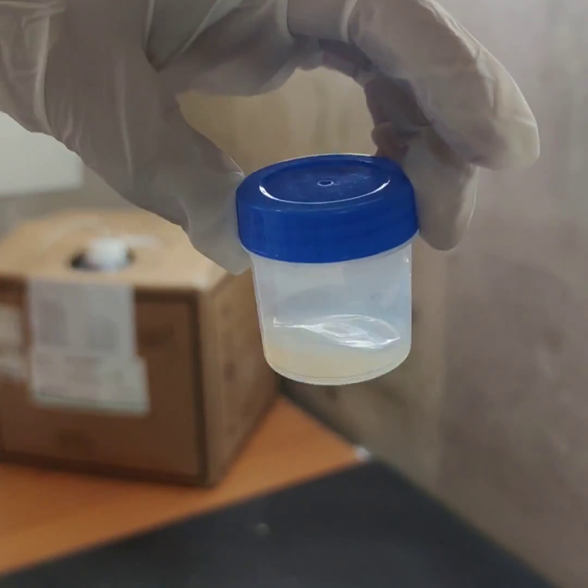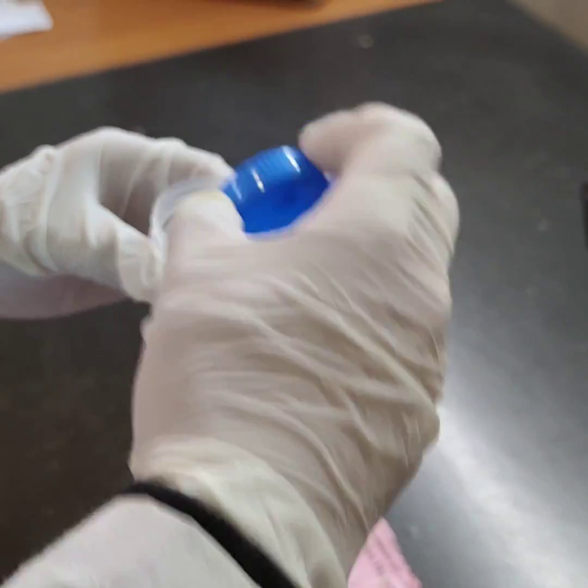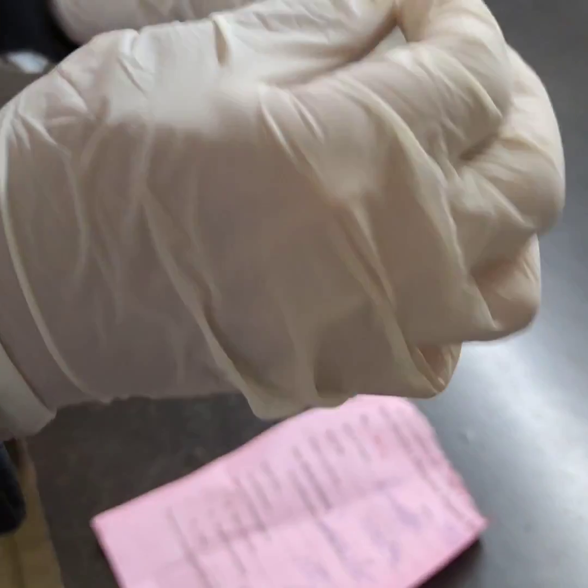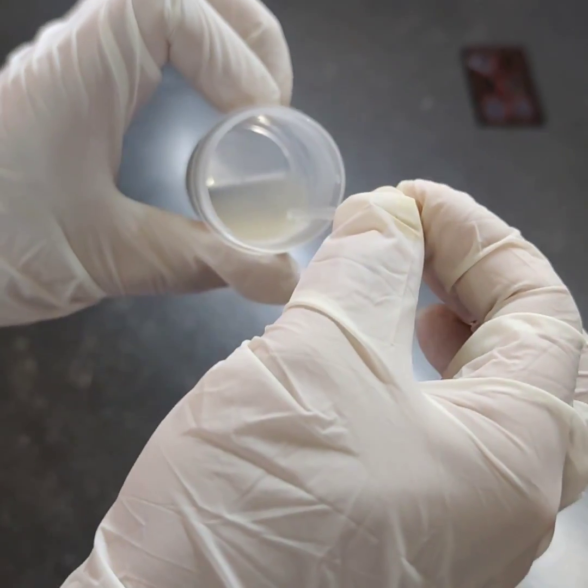Check the liquefaction whether the sample is properly liquefied or not. Make sure that the sample is properly liquefied. If not, then incubate the sample again till it liquefies properly.